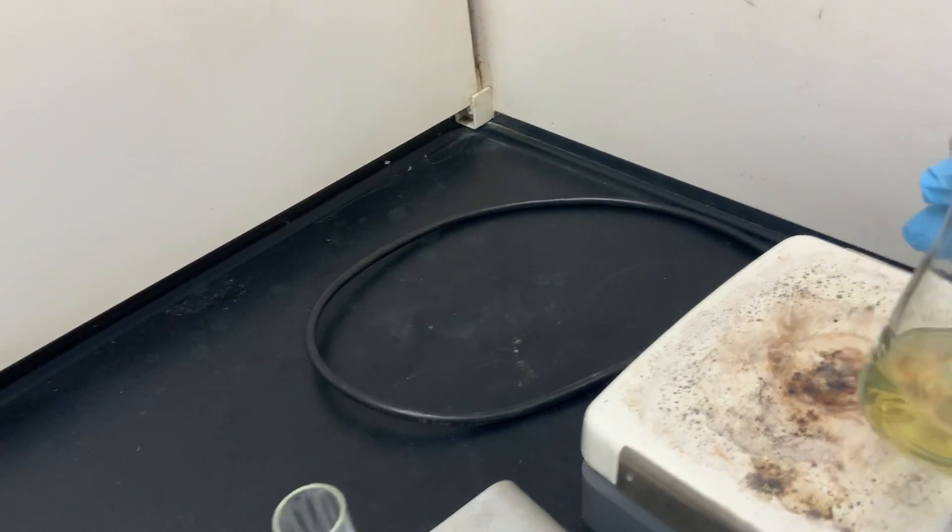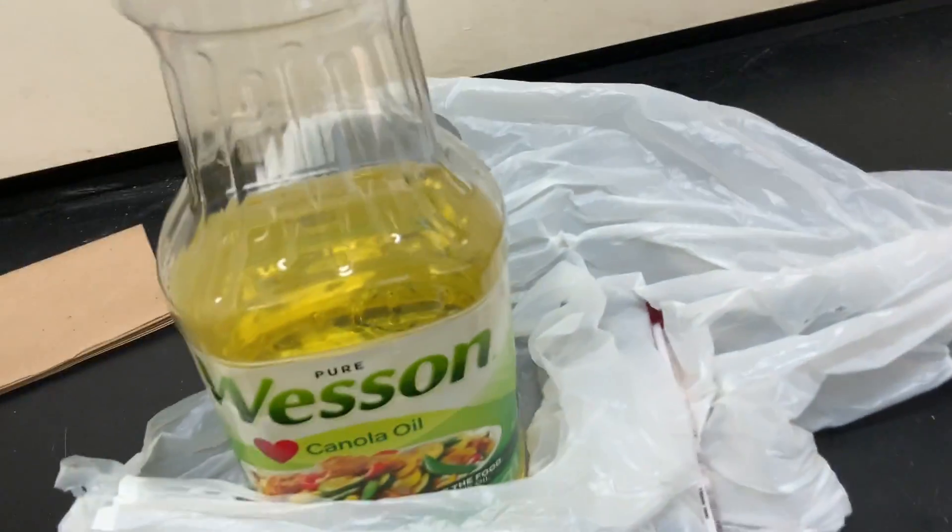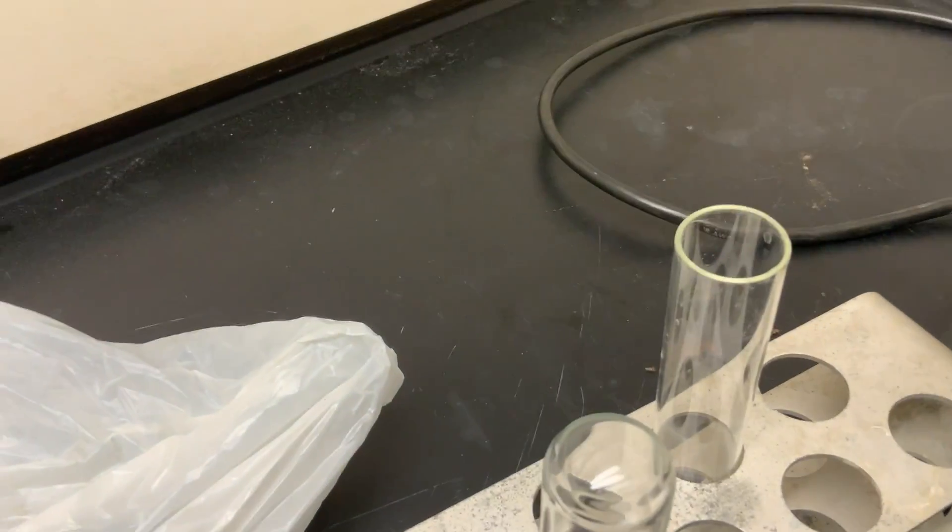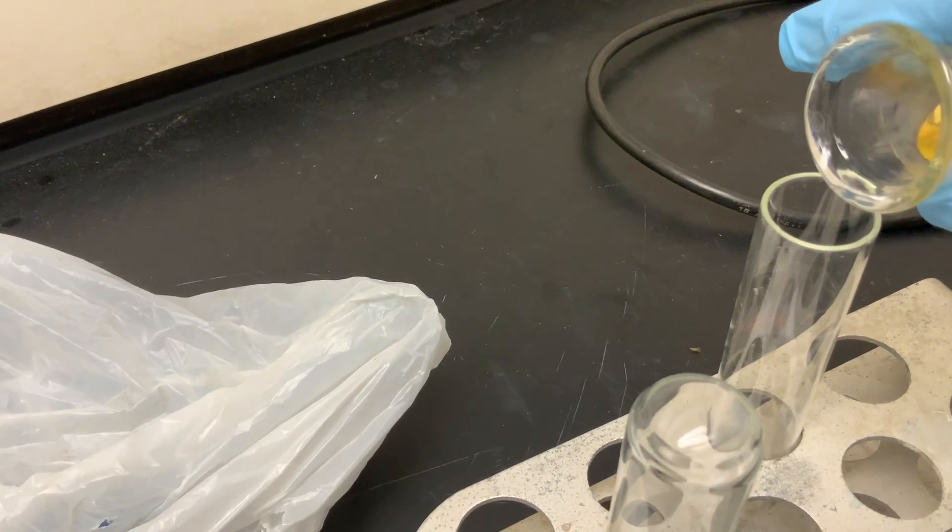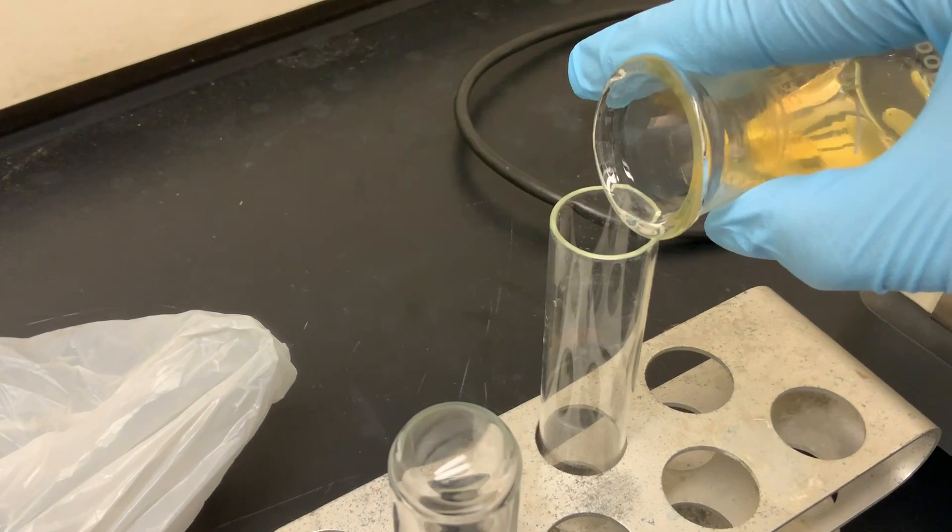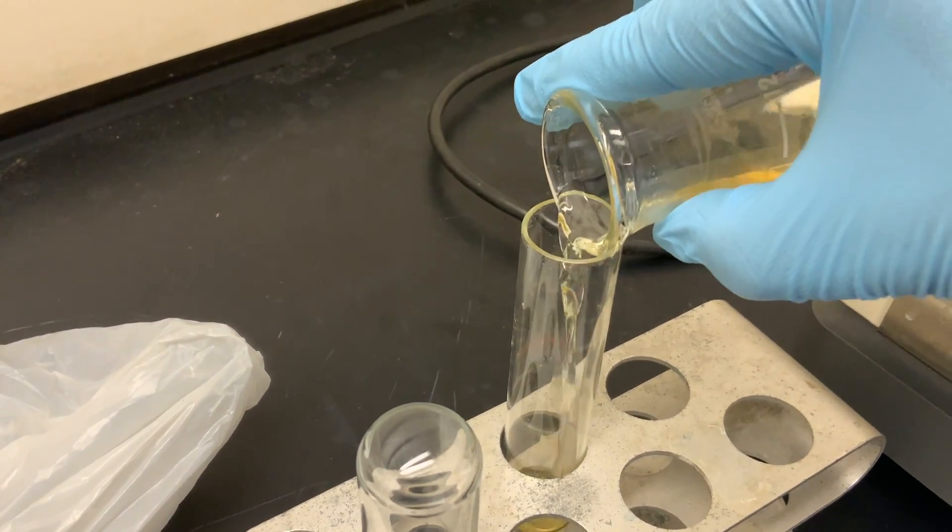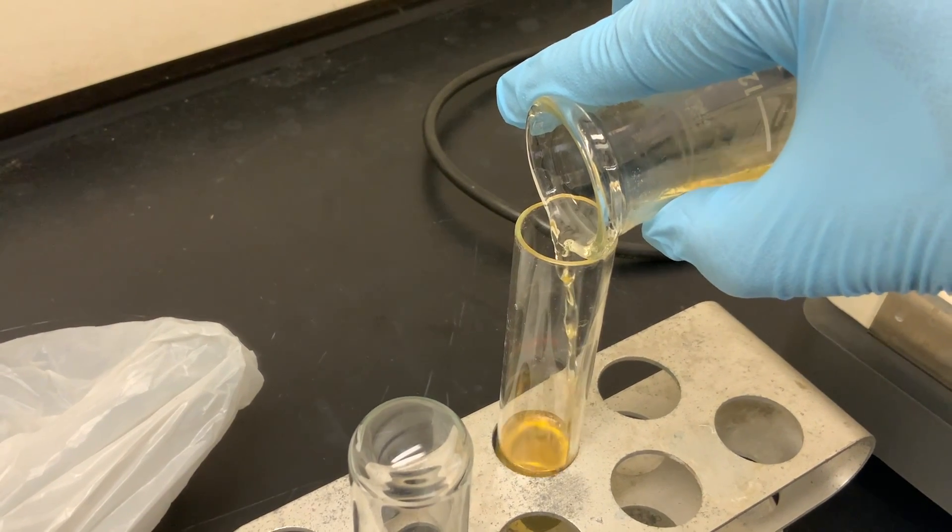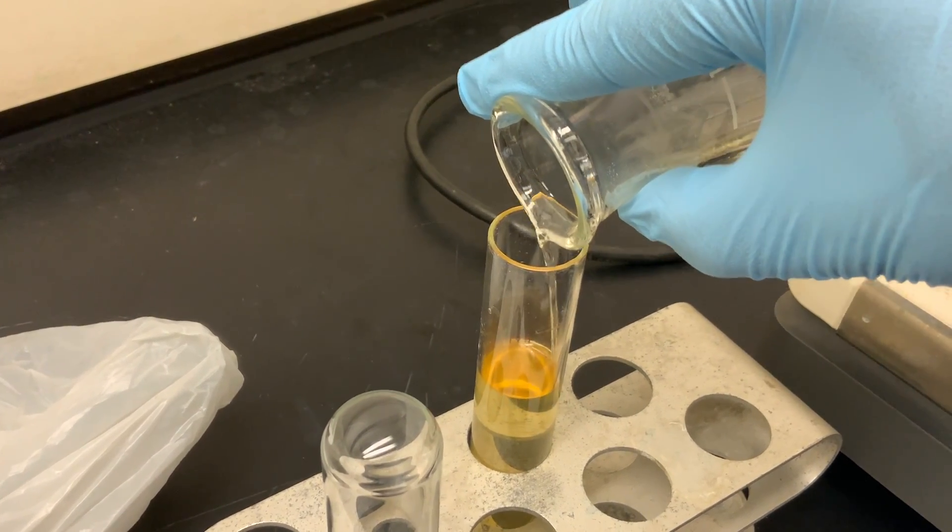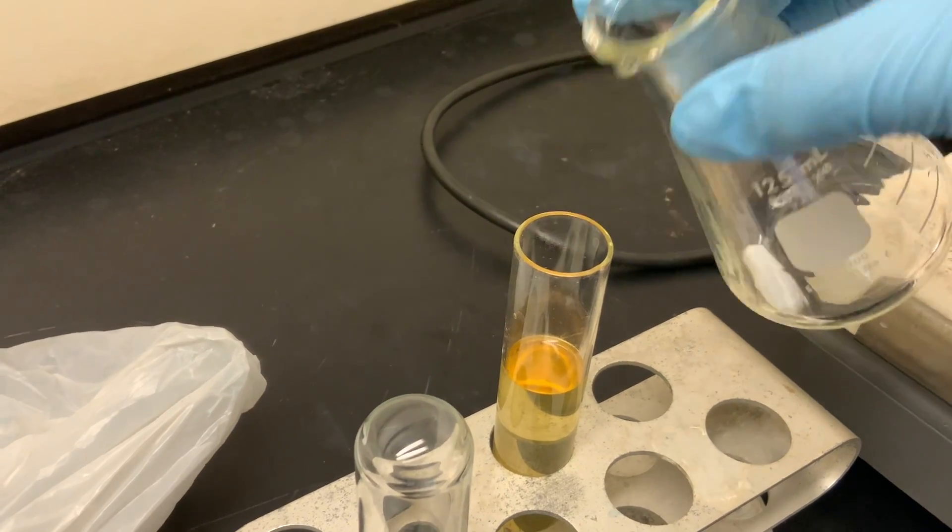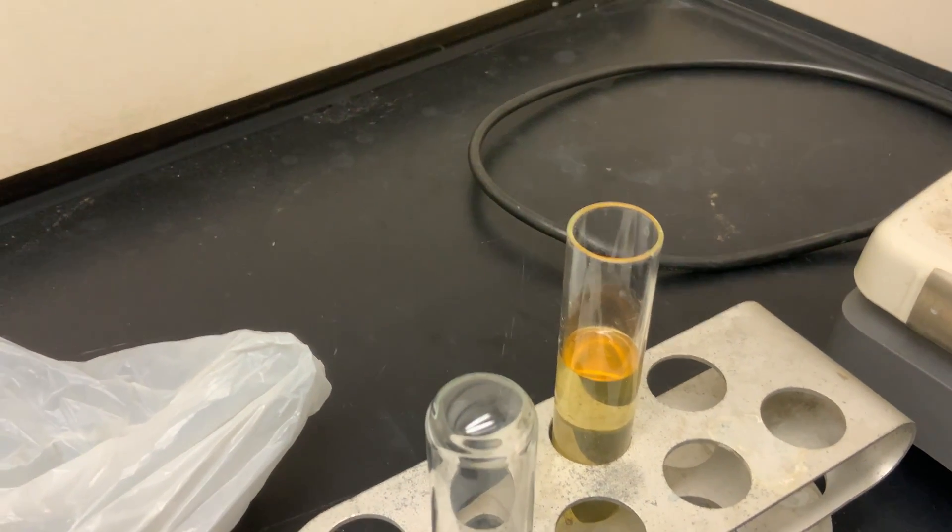We're going to transfer the mixture to a test tube and allow the mixture to separate into two distinctive layers.